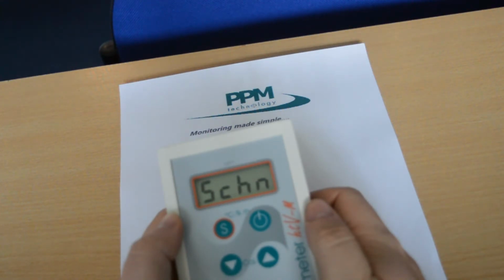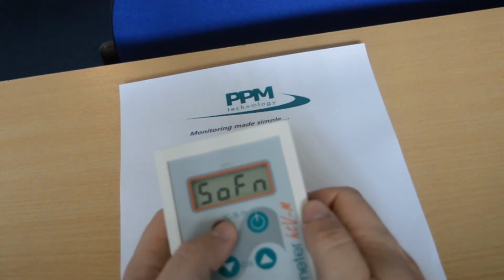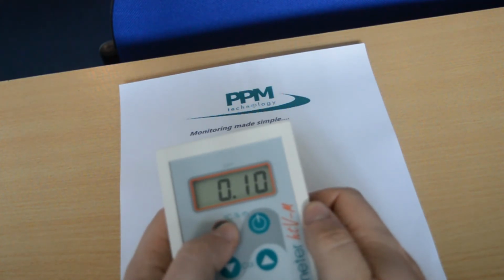Release all the buttons and step through the menu by pressing the S button until you reach the display LT equals. If you see the brackets when attempting to alter the setting, then you must reset the instrument first. See the video on troubleshooting for more details.